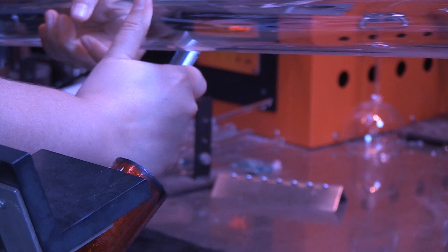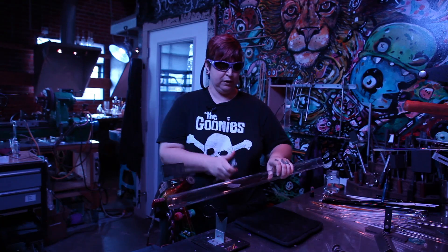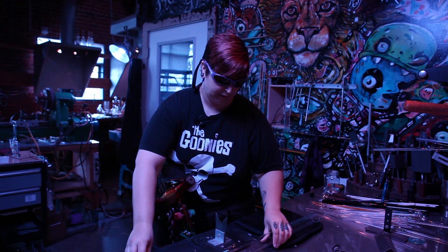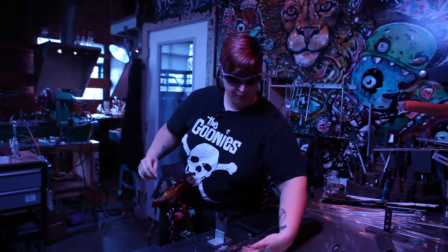You want to hear this really awful grating noise when you do it. You're only going to make a score that's about half inch to one inch, and then balance it so that the tube is up off the table.